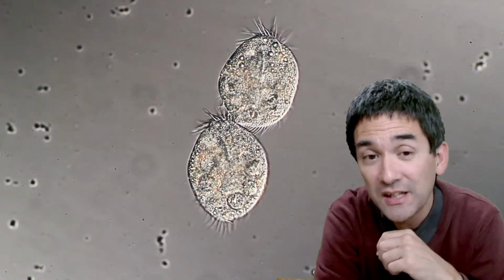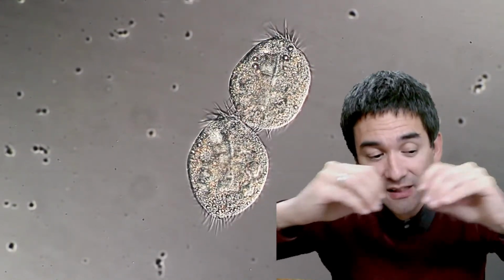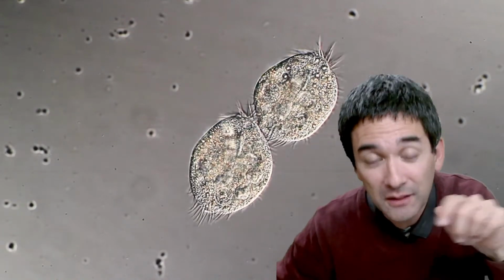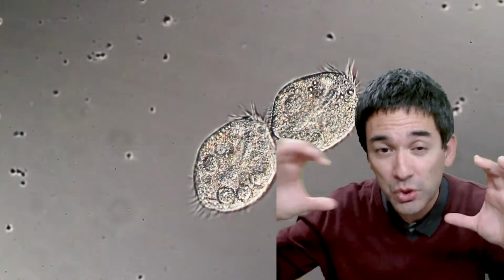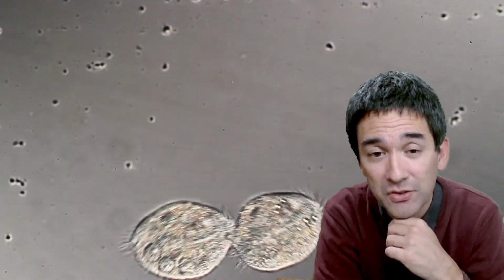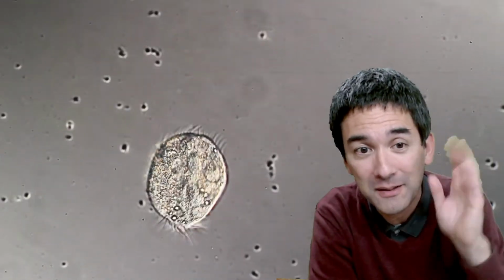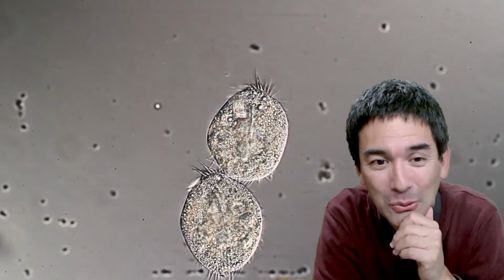And this here is an example which shows that the cell is folding inwards in the center. It's almost like a balloon being squeezed together in the center. Right? And the onion cells cannot do that because they have this strong cell wall on the outside, which is very inflexible. So they have to build a new cell membrane and cell wall from the inside. Here we go. Okay, now they're separate, and the video starts to loop.